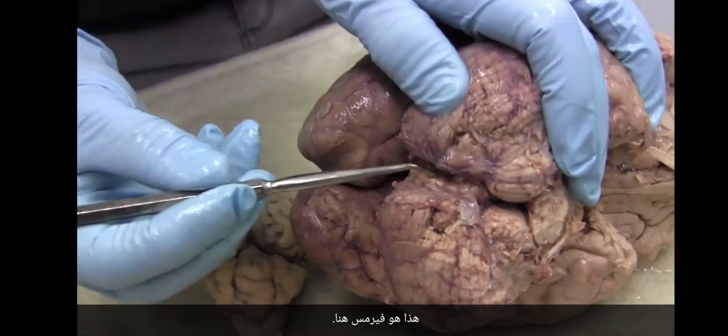The really cool thing that I learned by looking at sheep cerebellum is, look at this. Is it symmetrical? Is the vermis symmetrical? Well, not so much. You can see that it takes a jog. Look at that. It takes a jog. I saw that on one sheep brain, and then I saw it on a second sheep brain, and then on the third sheep brain, and then I went back and I found in the neuroanatomy books that, in fact, everyone's known that, or people may have forgotten it, but people knew it for a long time. There is no explanation for it. There's no sort of just-so story as to why that would be, but it's very interesting that the vermis takes a jog, and the vermis of the human takes a jog too.